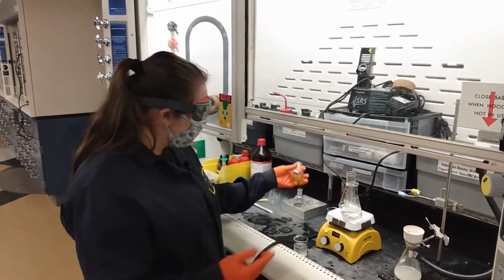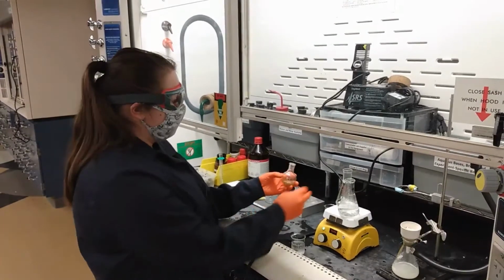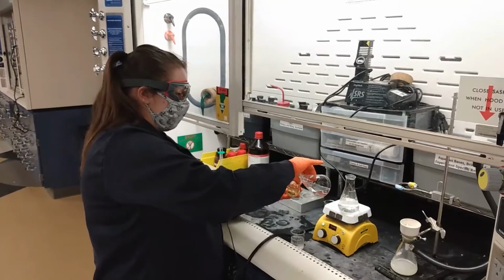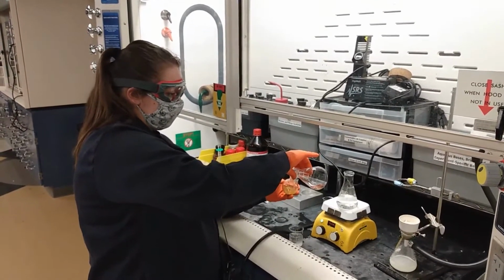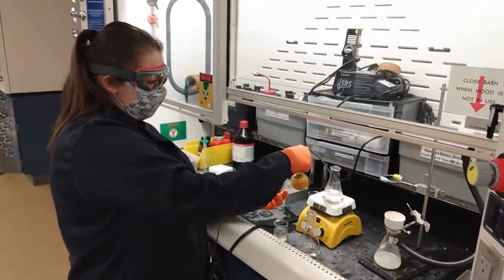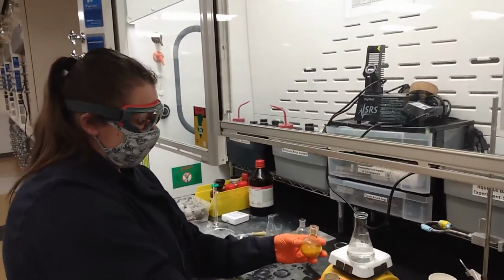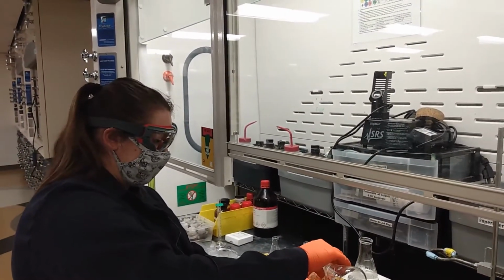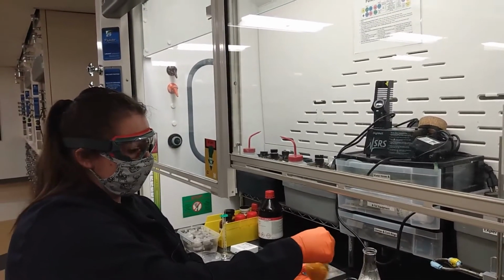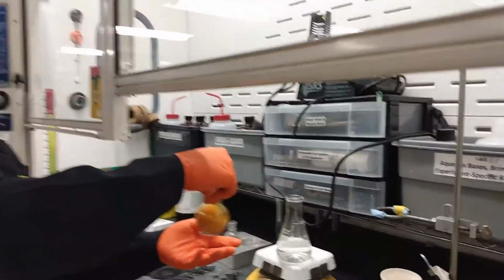For the Coumarin, we have this, which stirred for about 20 to 30 minutes, and the boiling methanol. I'm going to just add that into here, enough so that it fully dissolves. Stir that around. Add a little bit more. We want it to be fully dissolved, so we want it to be more of a clear instead of an opaque color, because the opaque still indicates that there's solids floating around in there.